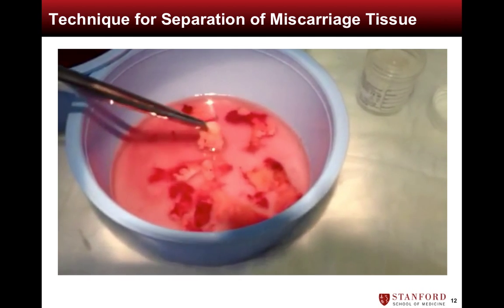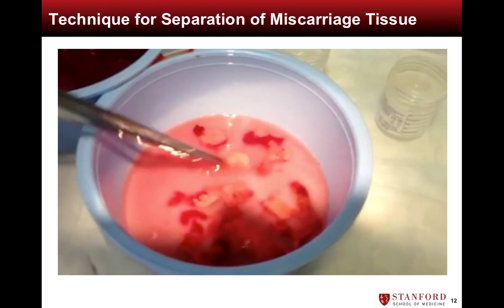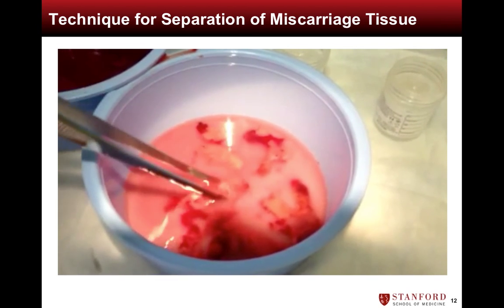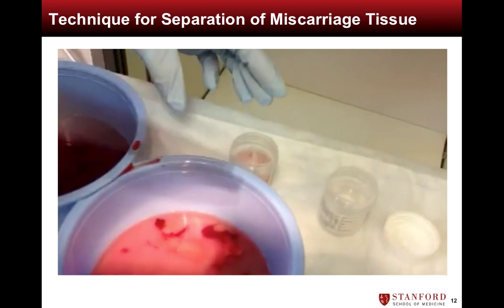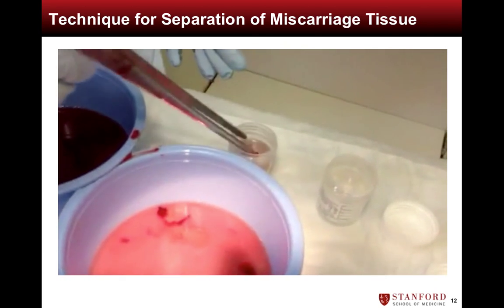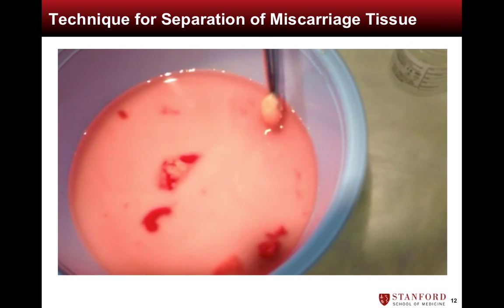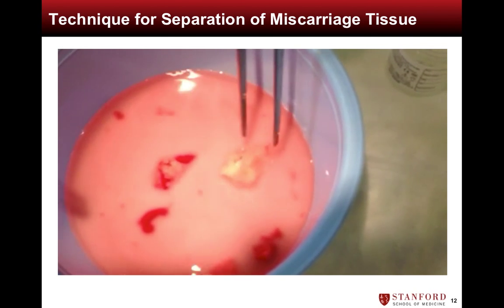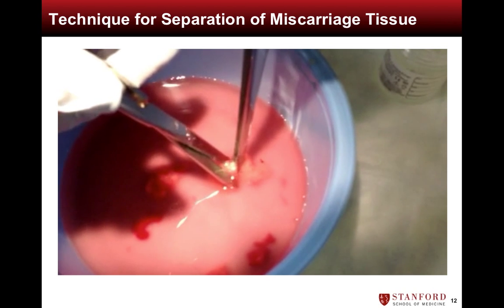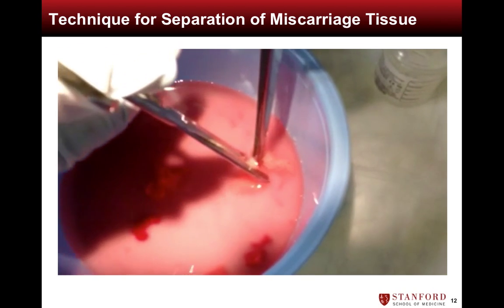The chorionic villi can be visually identified by their white and fluffy appearance. The decidua in contrast are red and more dense appearing. Segments of both decidua and villi are sent to pathology to demonstrate completeness of the MVA procedure, while only villi are submitted for chromosome analysis.